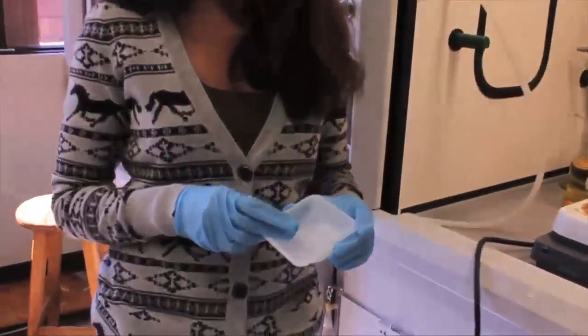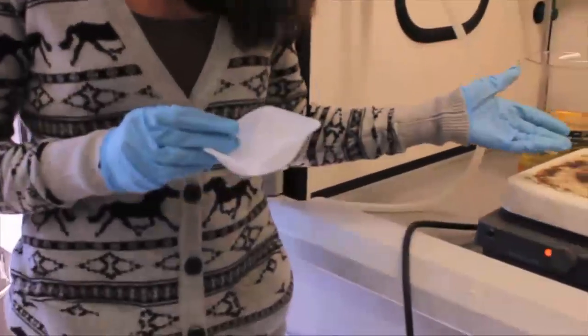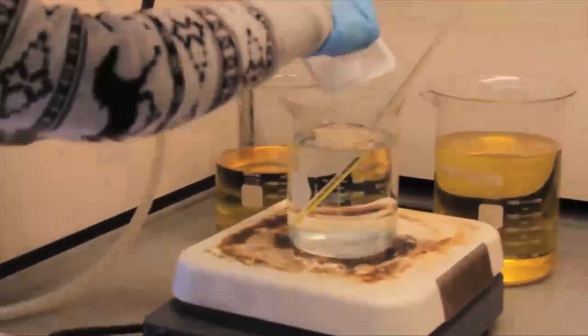In order to mix this with a biodiesel and make it effective, we need to mix it with a liquid, our methanol, which is right here. So I'm going to go ahead and mix this in.